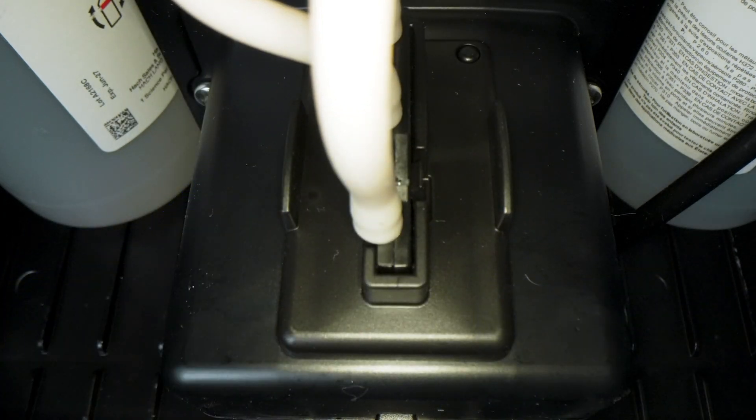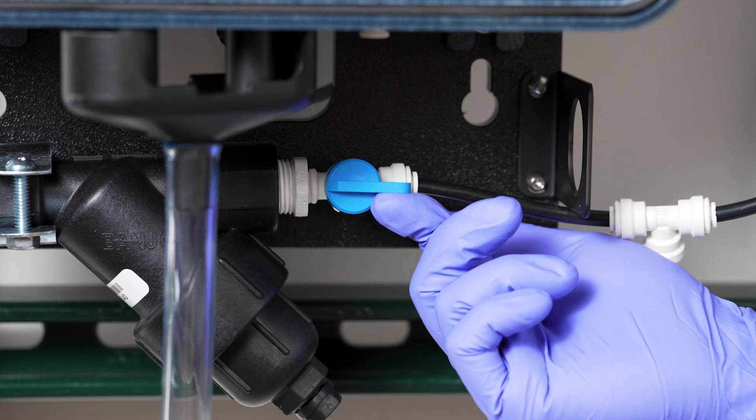Finally, reinsert the lid. Follow the task on the menu, then open up Influent Flow.